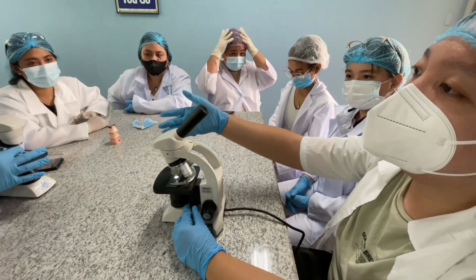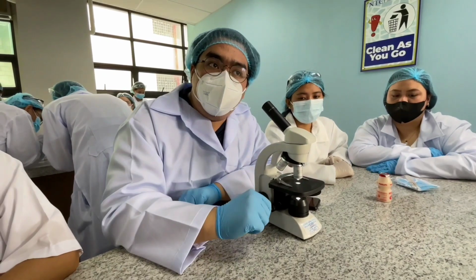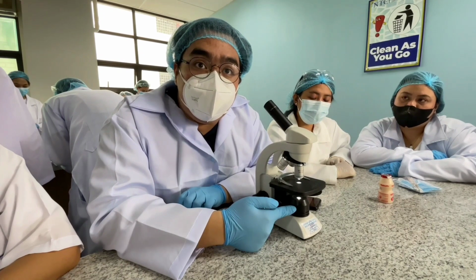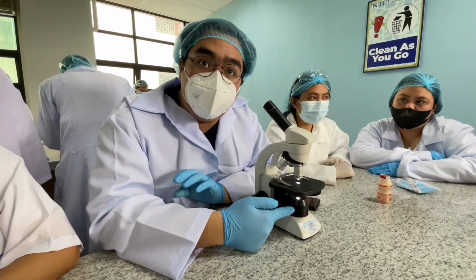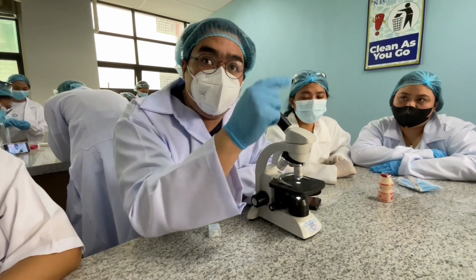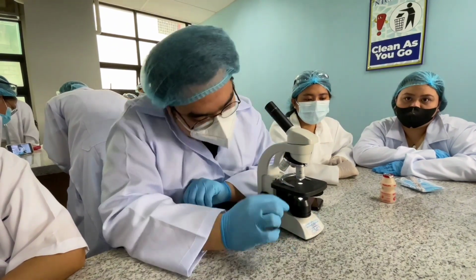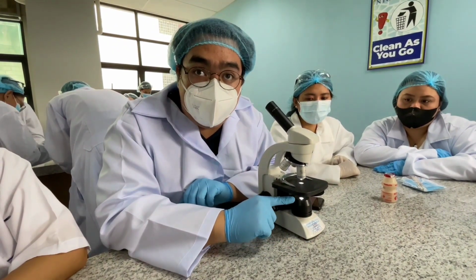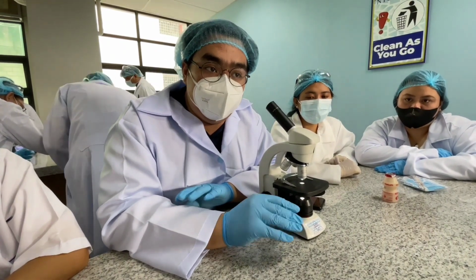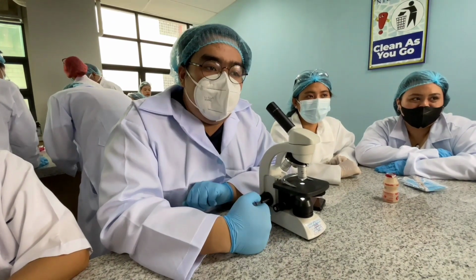And of course, hindi mawawala ang microscope kung wala ang ating last main component of a microscope, which is called the illuminator. Now, in your typical light-powered microscope, the illuminator consists of a simple mirror in order to reflect light from our source and towards the lens so we can see our specimen. But here, there's already like a flashlight in it, so there's no need to find a light source to observe it effectively because your light source is already there. So yes, thank you.